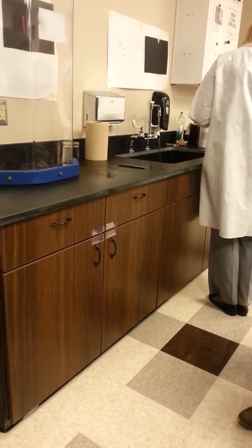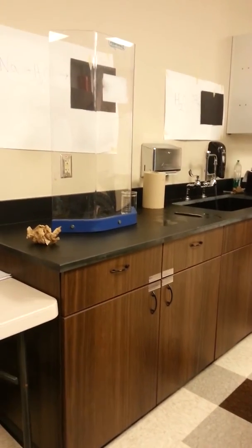Will you turn both lights out for me real quick? Yep. And I'm just going to take this piece of sodium, get the lights out, and I'm going to throw it in the sink. Ooh. Watch it. What are you hearing? Sizzling sound. What's that an indicator of? Oh, you got a good one. This one's really on fire, you guys. Oh, gross. You got a good one. Okay, I'm fine.